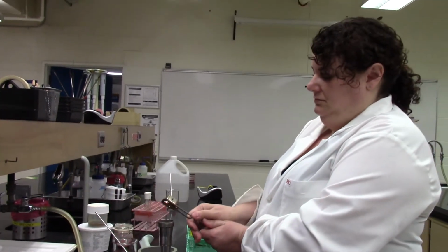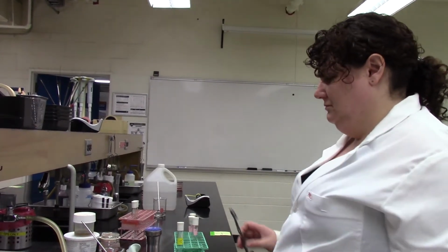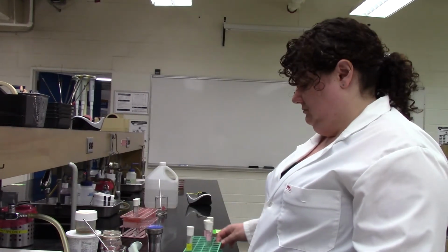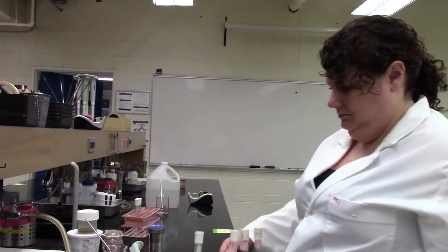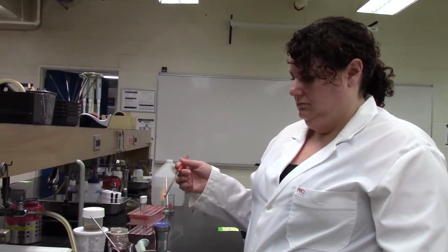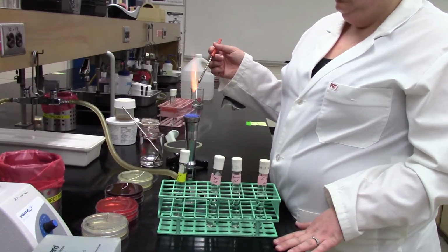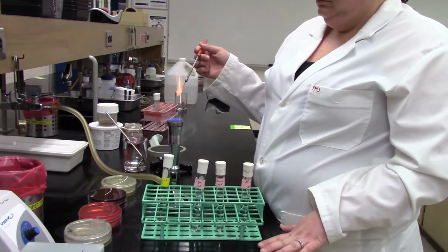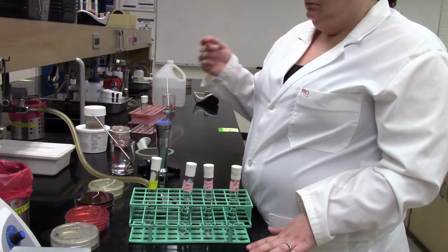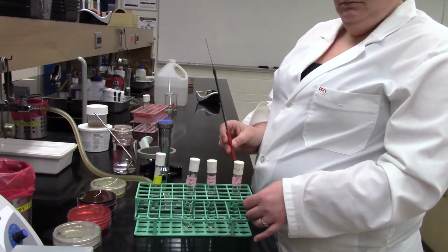So one of the things that you always want to do when you're looking at a food sample where you don't know what type of bacteria are in there or what you might expect to see, you want to do some known bacteria. So you know that you're seeing the expected results on those selective and differential media plates. So we are going to look at 3 types of known bacteria. And we've had Melinda dilute these out a little bit for us so they don't look as turbid as you typically would. This way we can get nice kind of colonies forming on the plates.